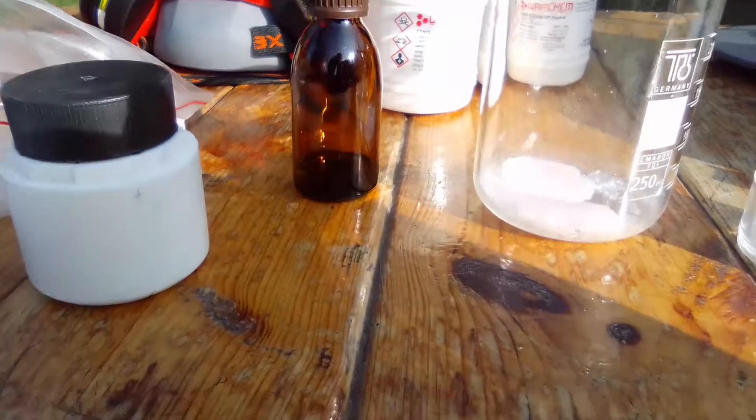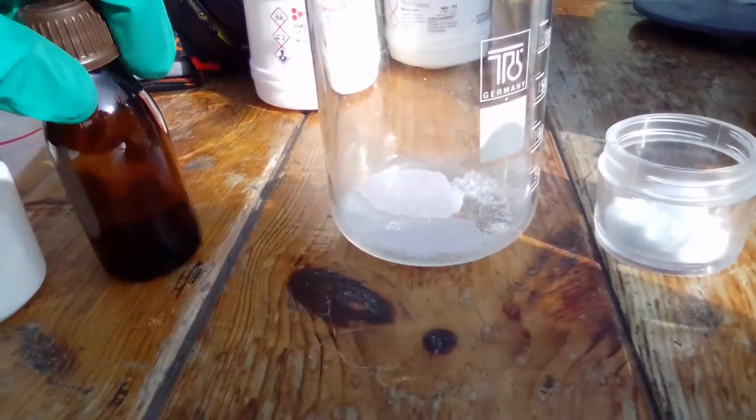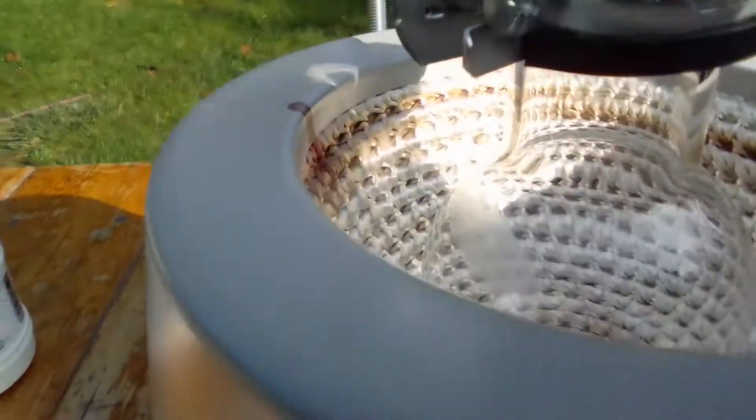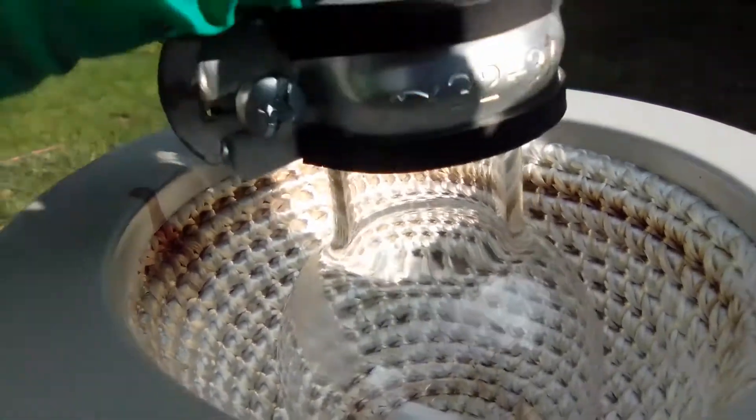So we're just going to heat up the phenol and oxalic acid with the catalyst Sulfuric Acid here. I'm just going to put all of this into the flask.